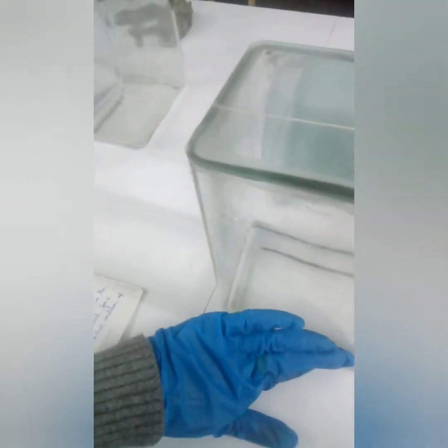So using this paper chromatography, we will load our sample here, and that sample will move along with the solvent. So here the solvent is a moving solvent. It is a mobile phase, and this chromatography paper acts as a support phase, as a solid phase. The molecules in the sample will be retained based on the molecular size, the shape, and the binding affinity to this solid phase or the paper.